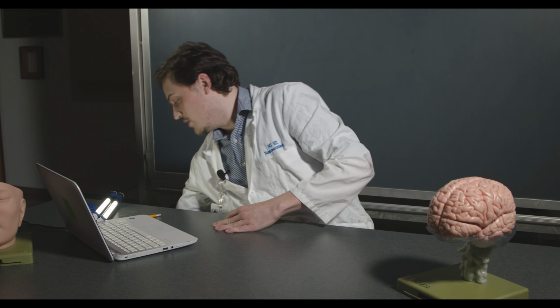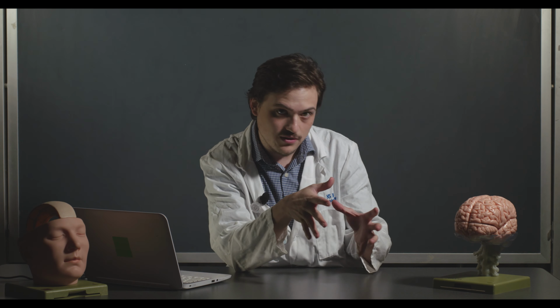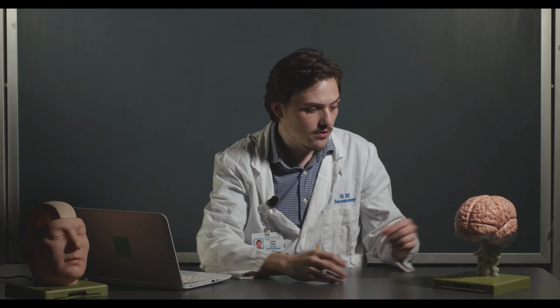But in case you don't have one of those, we're going to essentially show you some of those structures here. So I'm actually going to face, there's another camera over here, and I'm actually going to face a little bit this way, so hopefully you can see all of them as I point them out. So I'm going to grab this guy here.